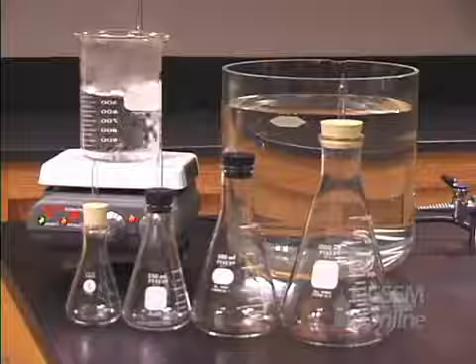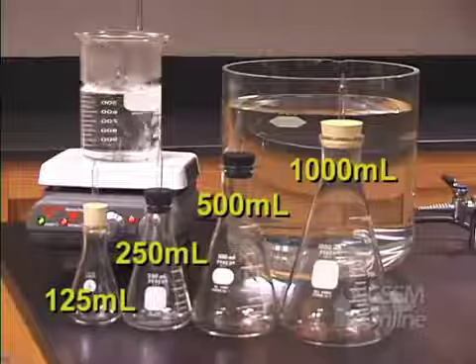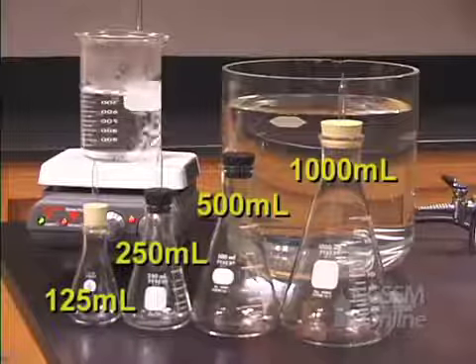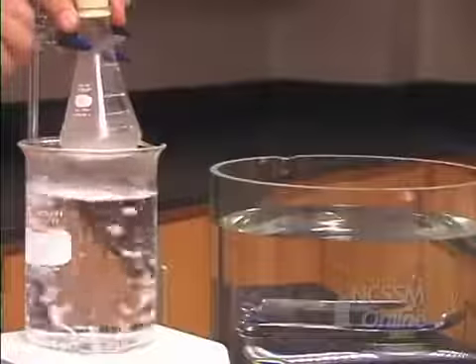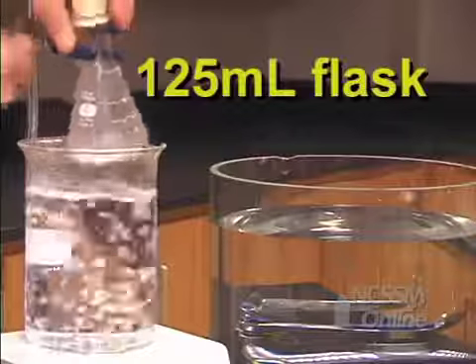We will give you data for 4 different flasks: a 125 milliliter flask, a 250 milliliter flask, a 500 milliliter flask, and a 1000 milliliter flask. We will take the 125 milliliter flask and place it in a boiling water bath.